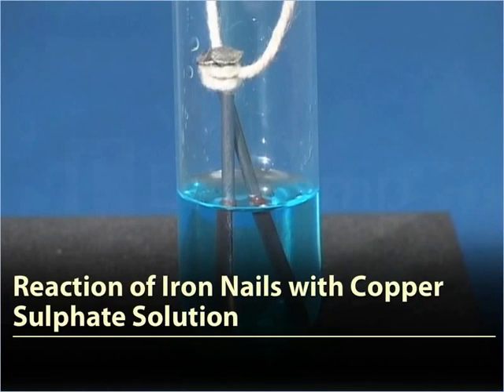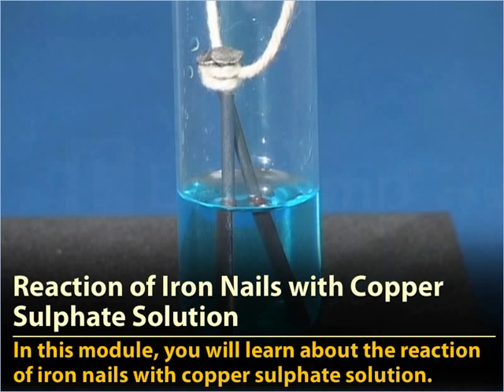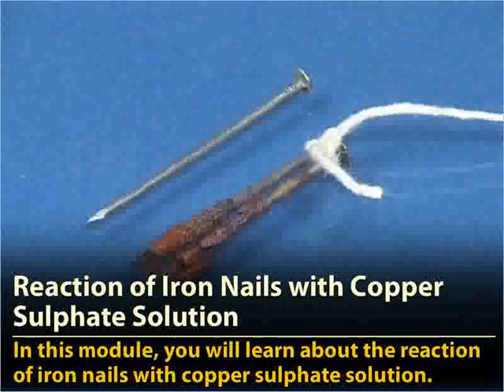Reaction of Iron Nails with Copper Sulfate Solution. In this module, you will learn about the reaction of iron nails with copper sulfate solution.